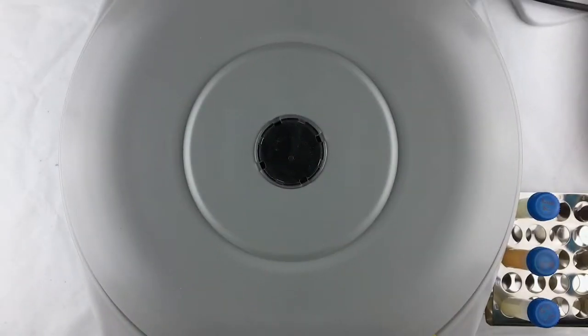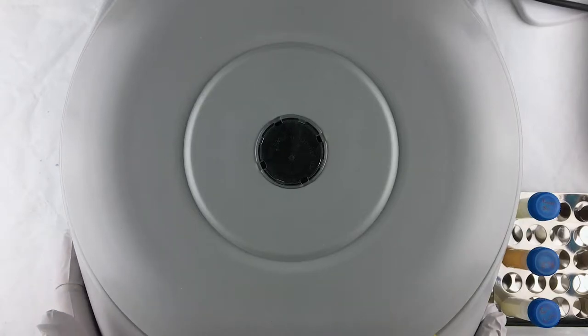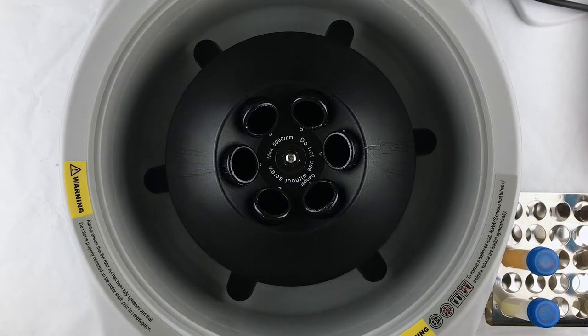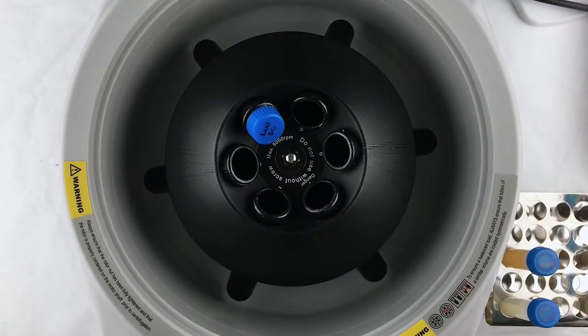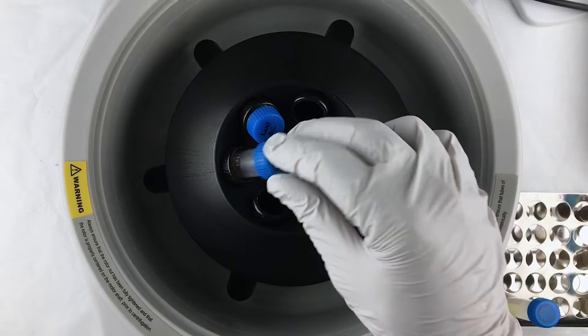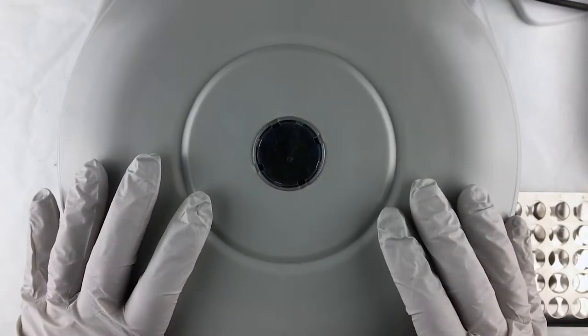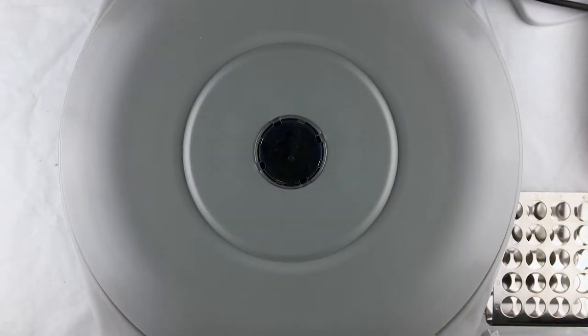Okay, now it's time to centrifuge the samples. We just finished with the incubation and now let me open the centrifuge here. So again, as with the incubation, I'm going to be centrifuging multiple samples at the same time just for efficiency's sake. So I have six spots in my centrifuge. I have six samples here. So I am going to centrifuge these now. I'm going to do it for 10 minutes at 2,500 G's.